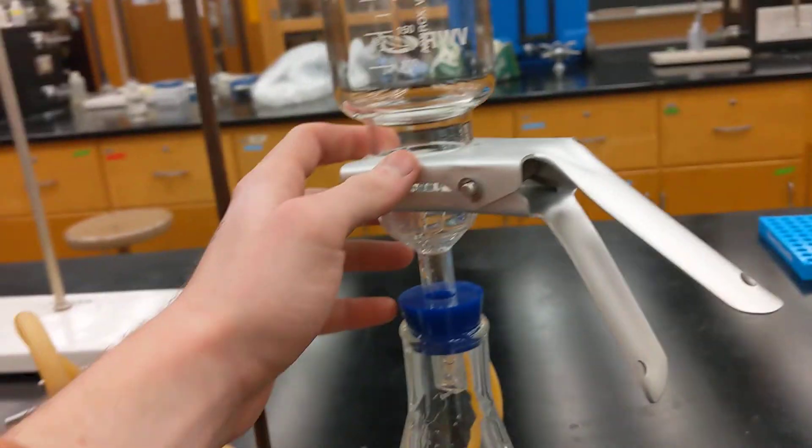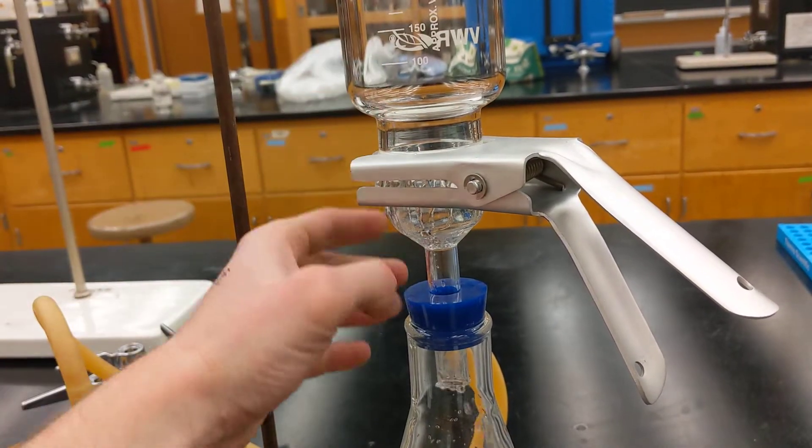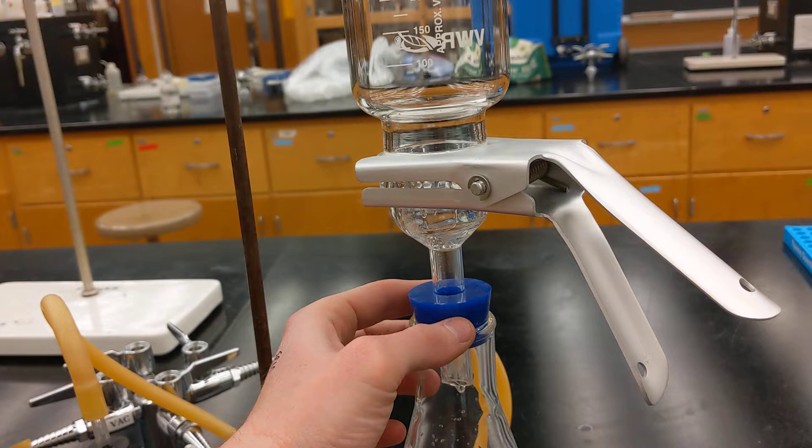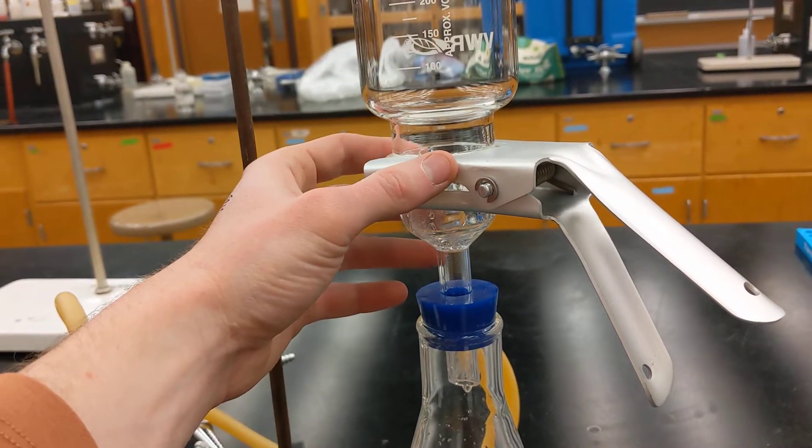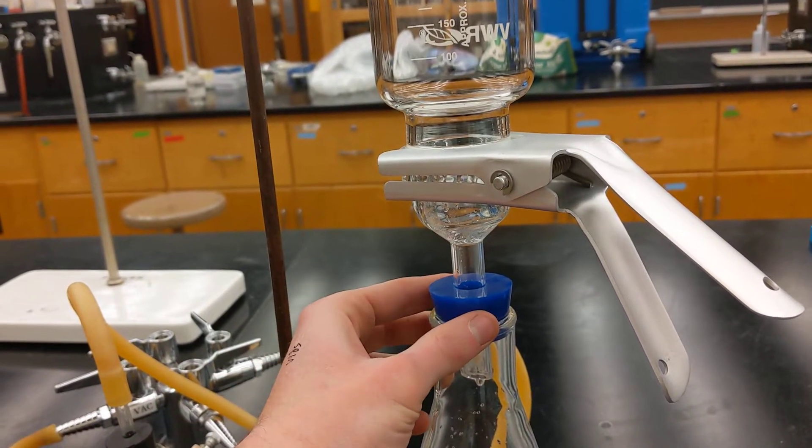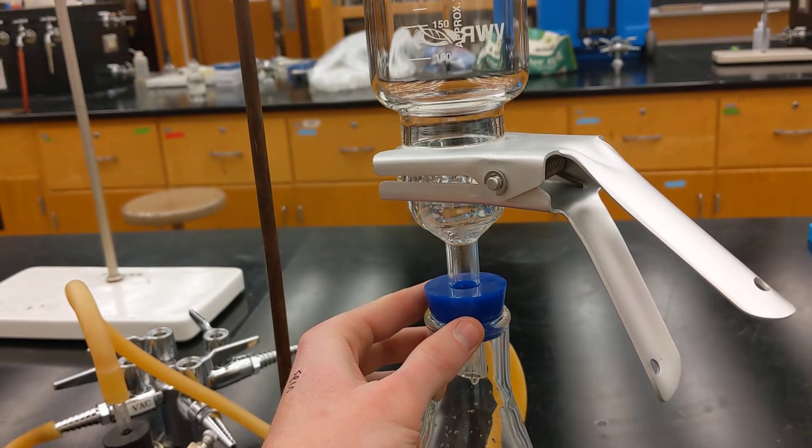If you have a tight seal, this object may not immediately want to break suction from the seal. So you want to hold the whole thing and gently rock it until you break some suction. You'll hear some air enter. I'll show you what that looks like.